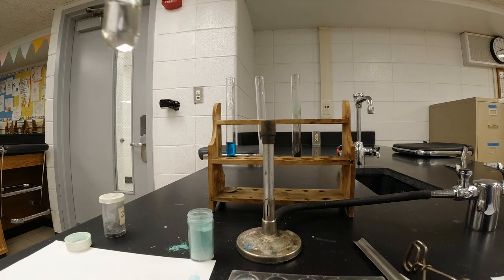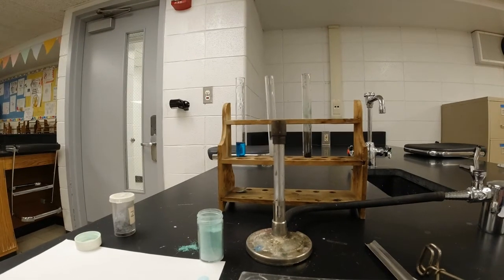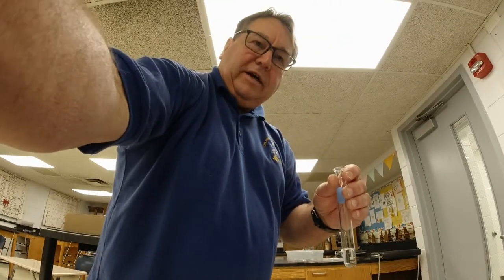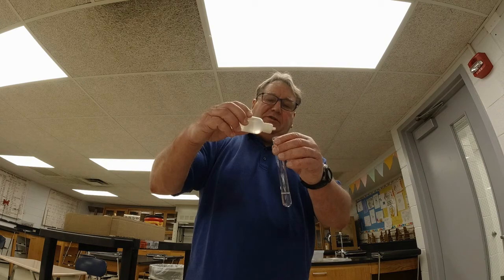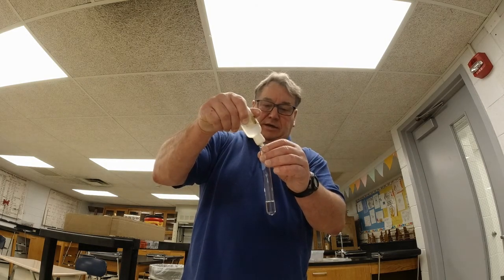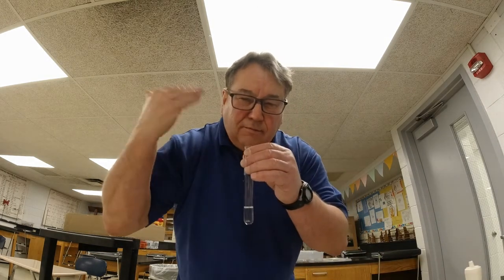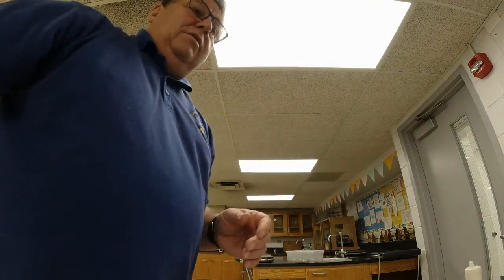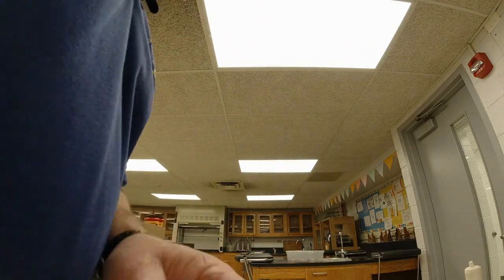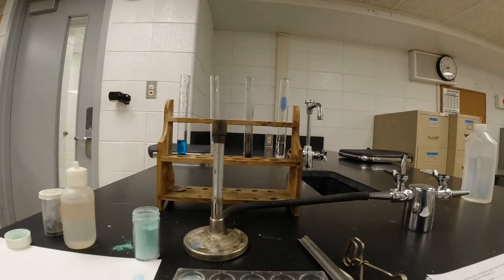And then it says you're going to add about 1 milliliter of the hydrochloric acid. All right, so let's get this thing pointed at me kind of here so you can see what's going on. I'm going to put the hydrochloric acid in here, just a couple of squirts like that, and then it says immediately smell it. So I waft it. Oh, there's a very sharp, kind of stinging odor that occurs.